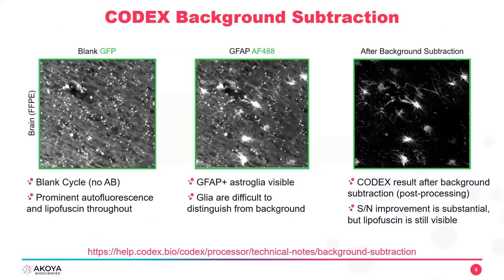So the way that autofluorescence is dealt with today in a CODEX experiment, for those of you who are doing CODEX and who are processing CODEX data, we have a very good background subtraction. So this is a digital way of removing autofluorescence, and this happens after you acquire your image. So let's take a look at this.